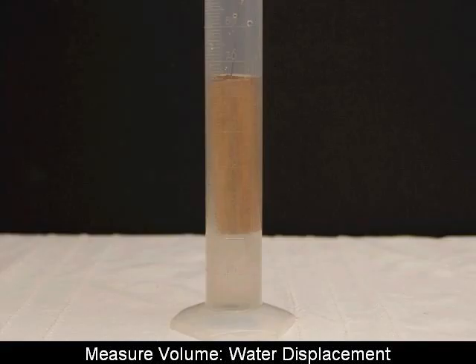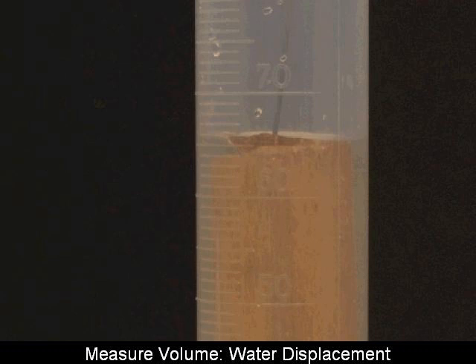Okay, so I've submerged that block, and maybe you can see that spatula running right through there, a little metal spatula that I'm pushing down with. Let me zoom in on that, and you can measure that final volume. Observe that. Record your result. Take the difference between this number and the initial volume before the block was added. Subtract those two, and that's your volume for the wooden block using the water displacement method.